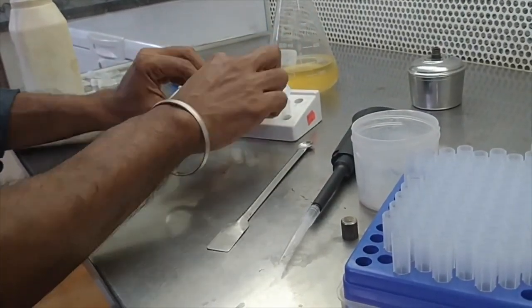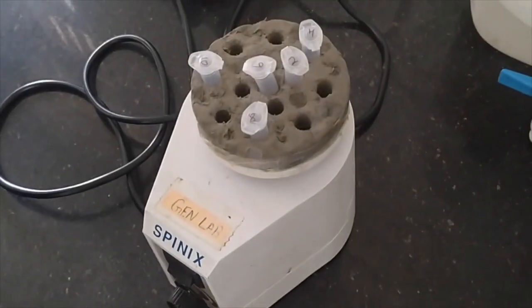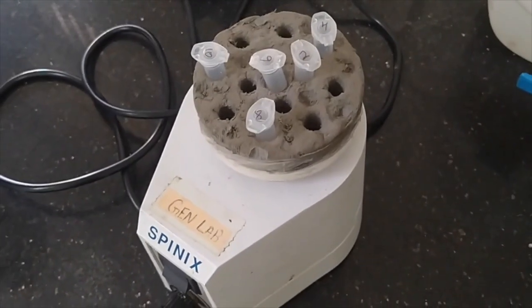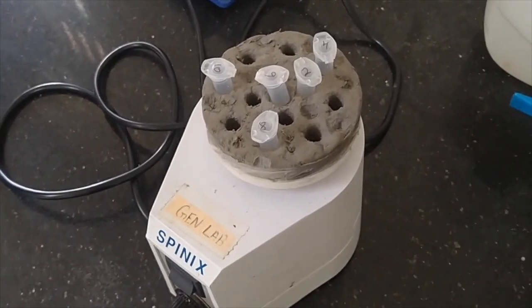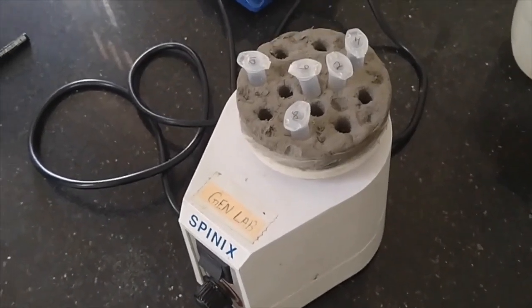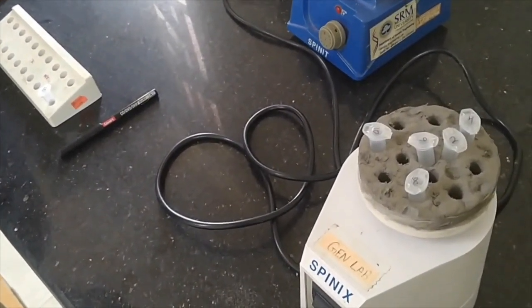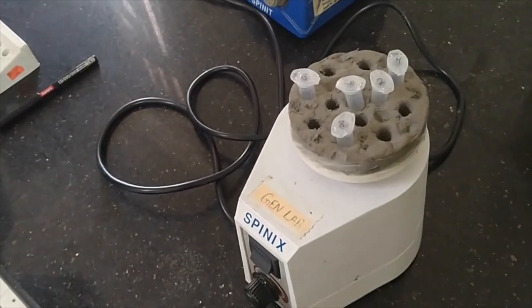So now the next step we are going to press this. Once you have added the beads, now you need to mix that. For that we kept the samples in the Vortex machine. You can see 5 samples, each at 2 minutes interval. The one which we are having as blank has not had beads added, and we are not going to keep it for the mixing.